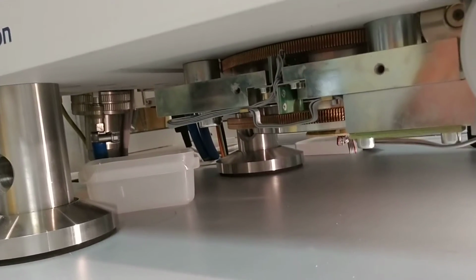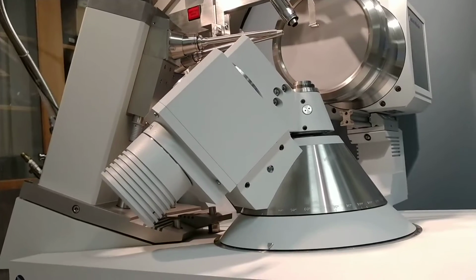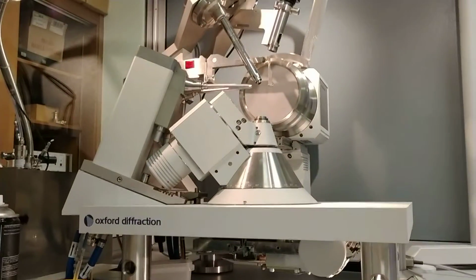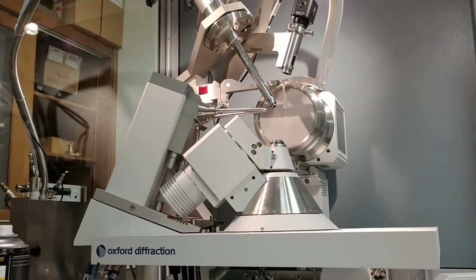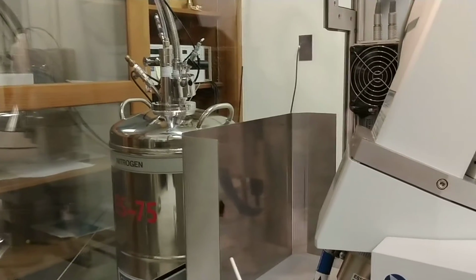Let me guess. We're moving Omega to zero, then we're going to move Theta to zero, and then we're going to move Omega positive. Oh, I forgot that one. Okay, so I'm at zero. You want me to go to minus 90? Minus 150. I'll do the whole thing. Yep.